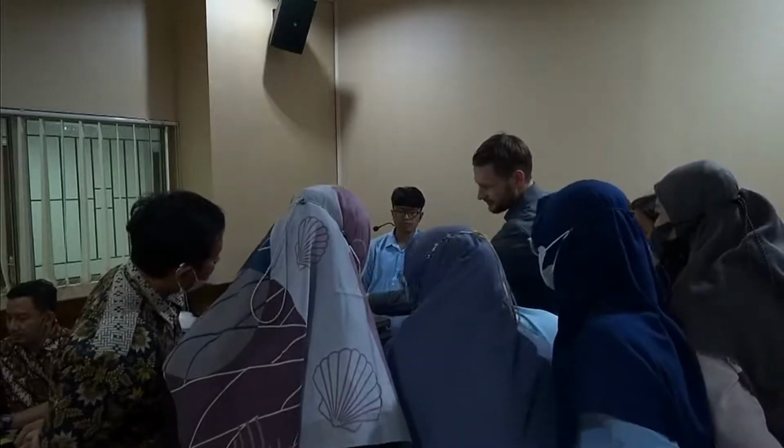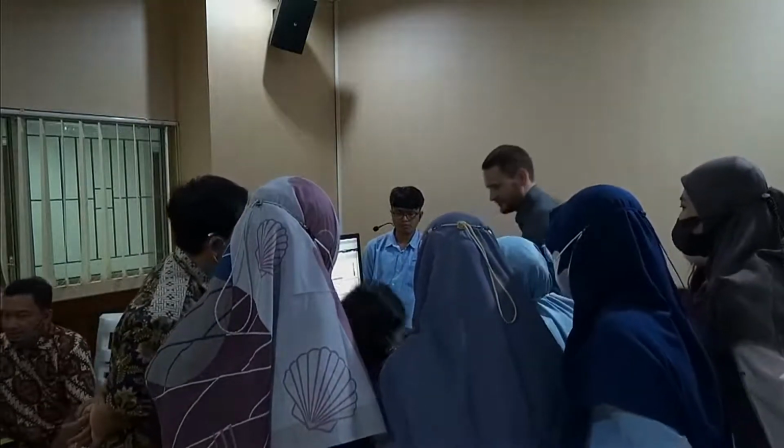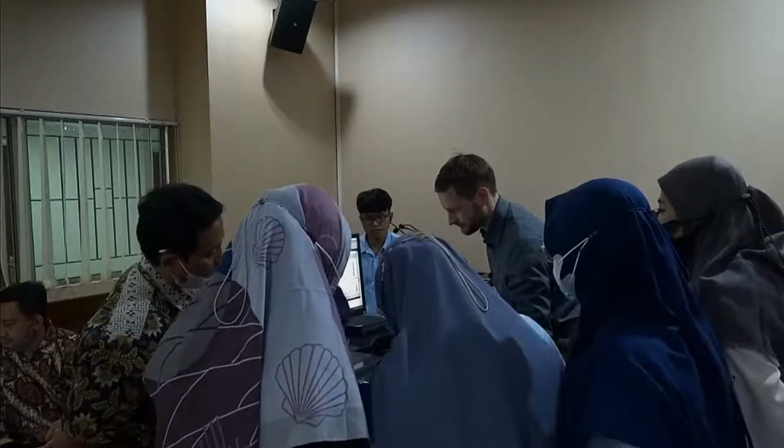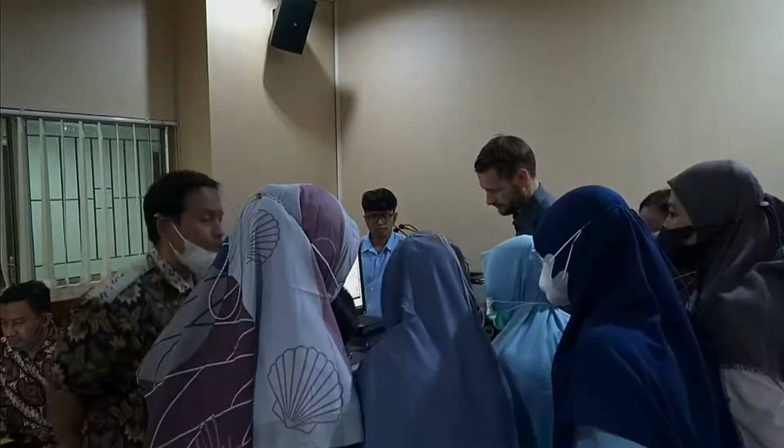So this is, you see, also a good example. I still have some from the previous group, so I can just add this. So now it looks good to me.